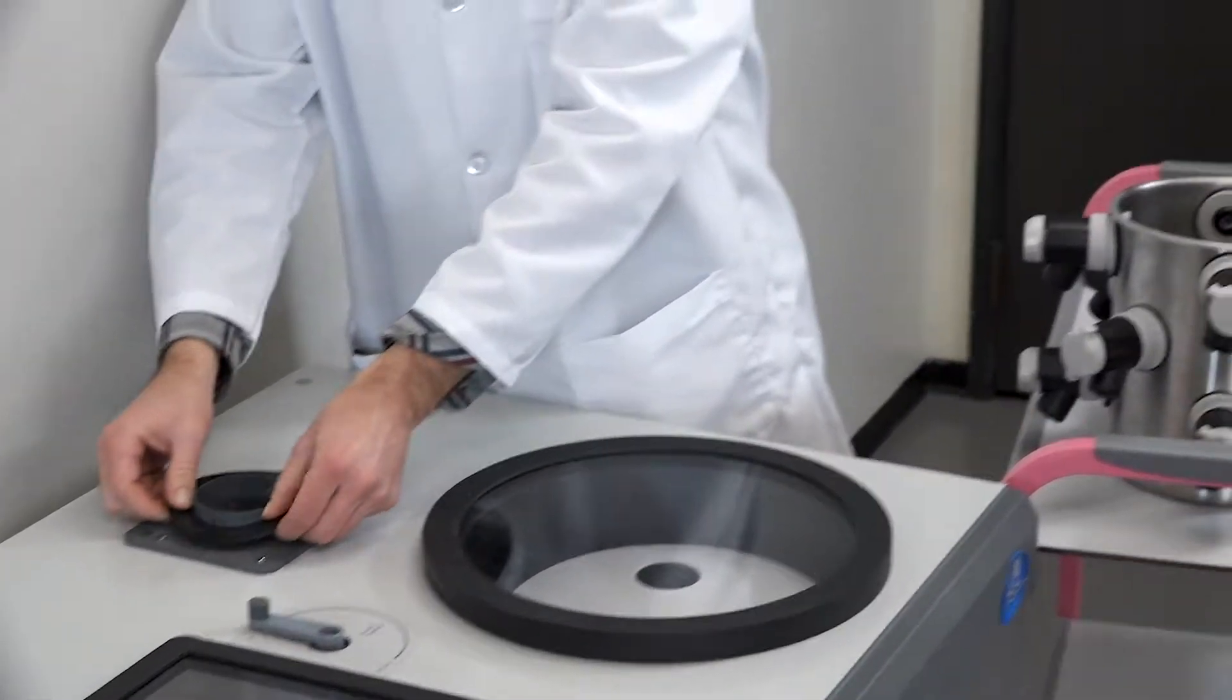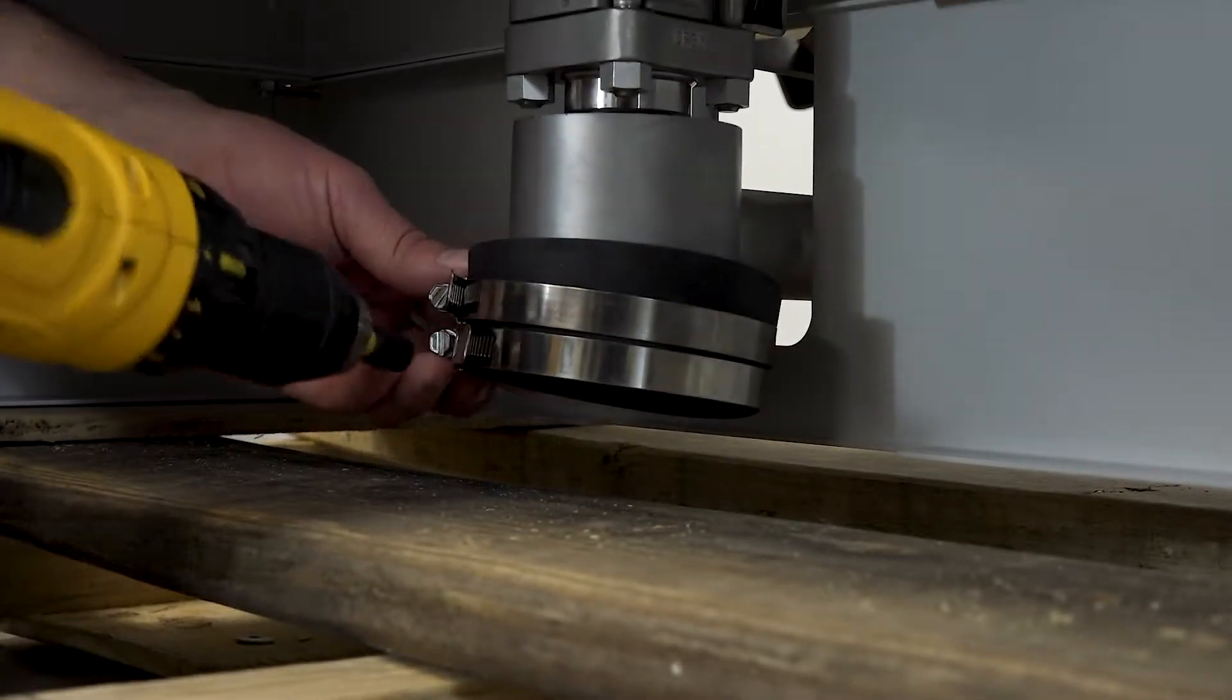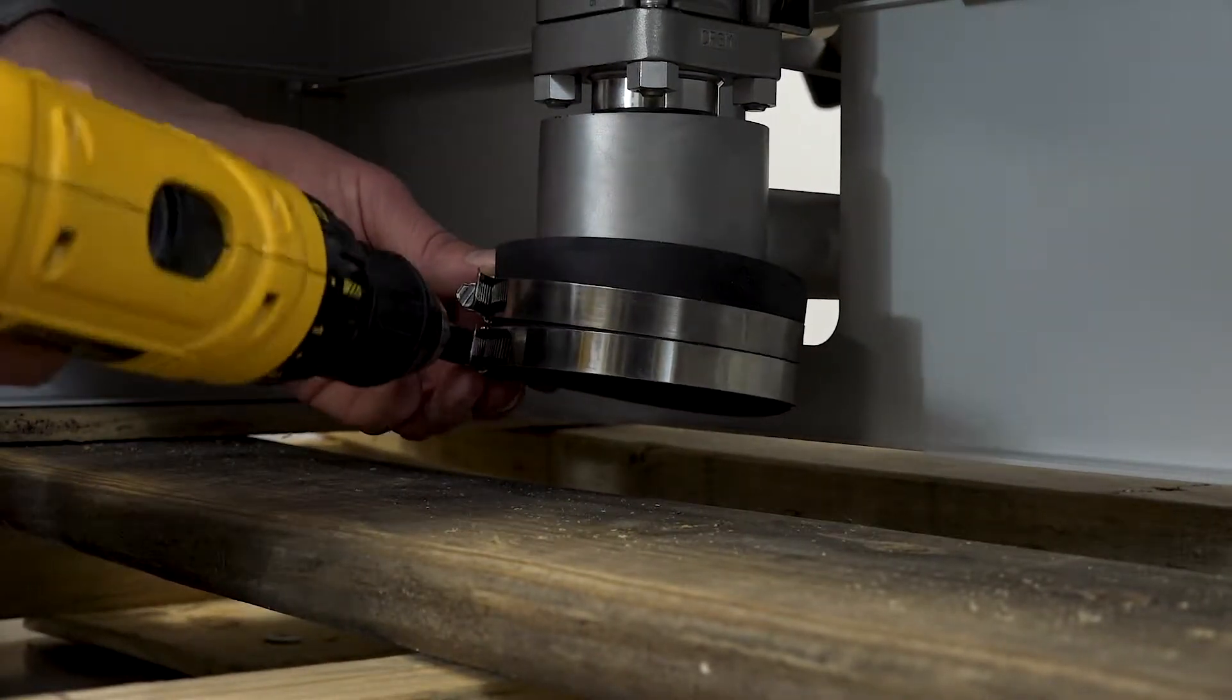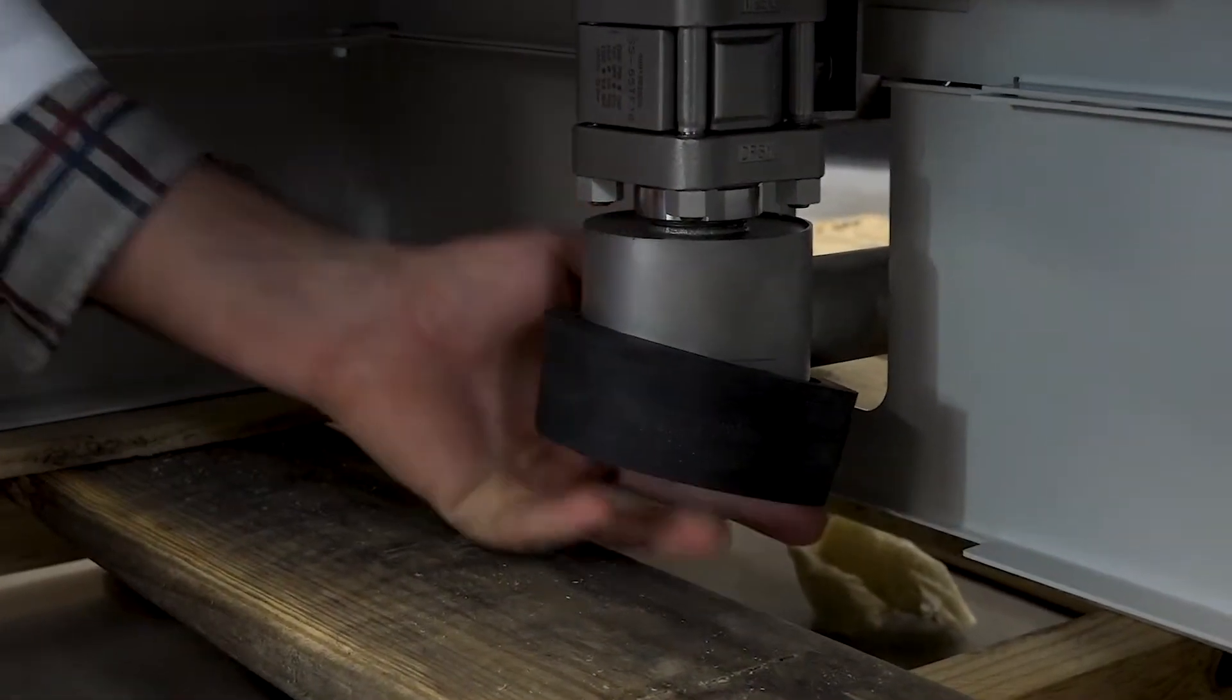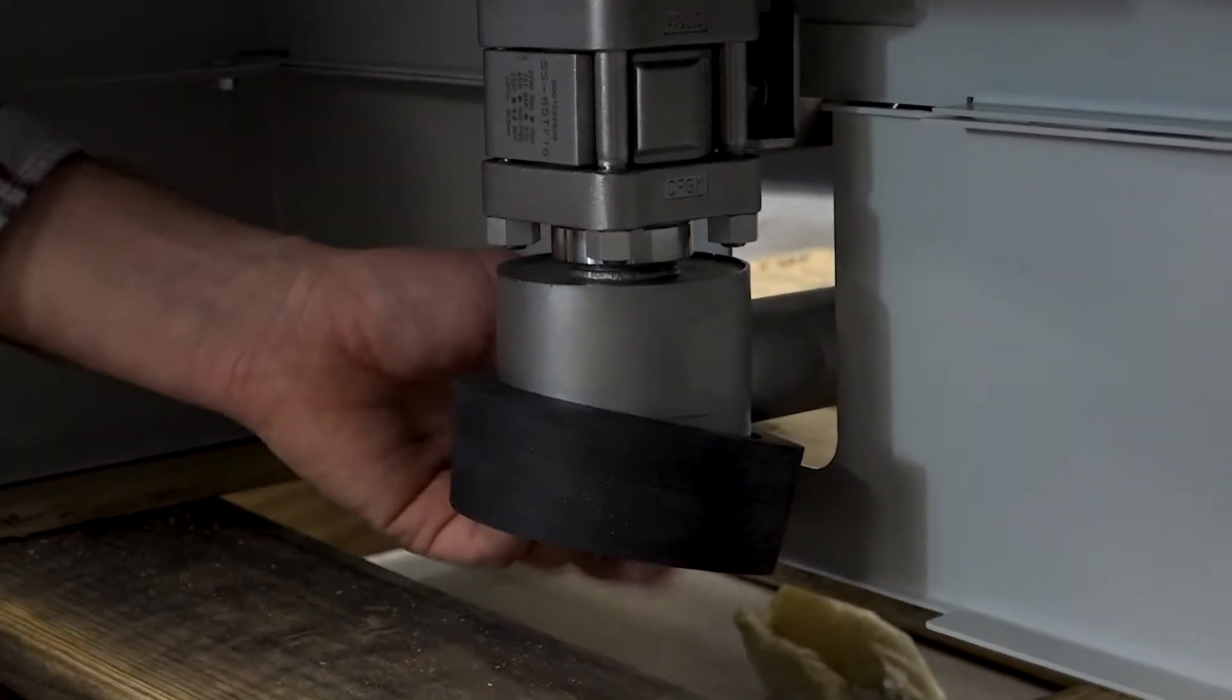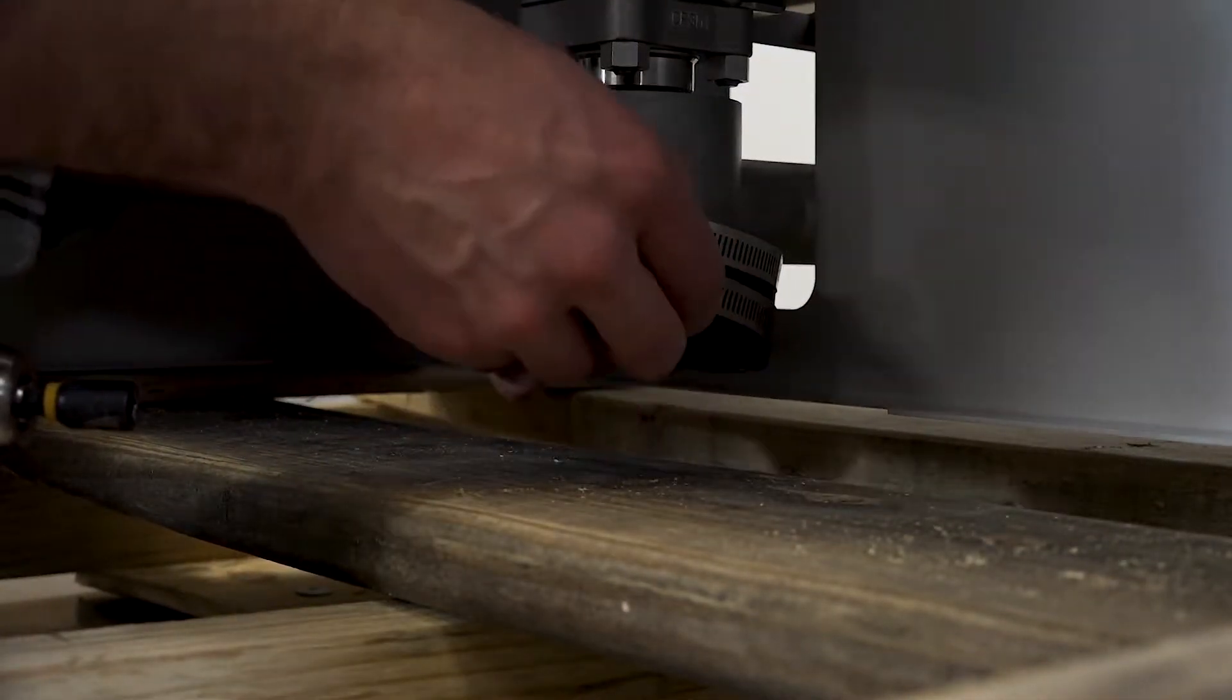Ensure the flat gasket has been removed from the three-inch port on the freeze dryer. Loosen both clamps on the lower rubber coupling and slide the coupling upward so the bottom edge of the coupling is above the lower edge of the stainless steel tube. Loosely tighten both clamps on the coupling to hold them in place.